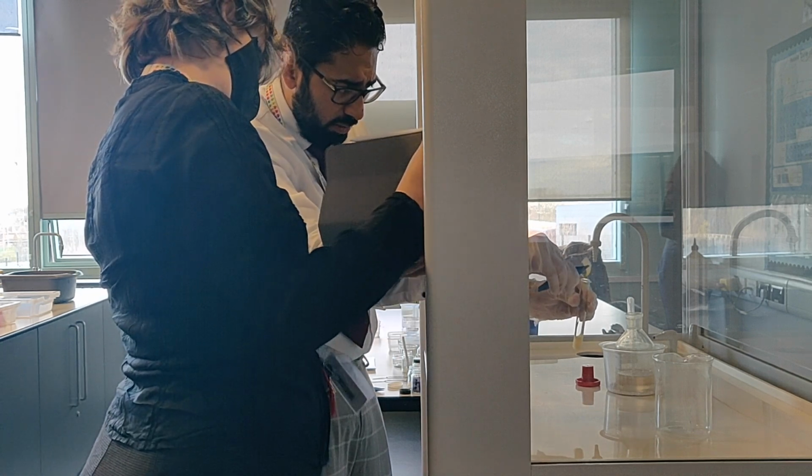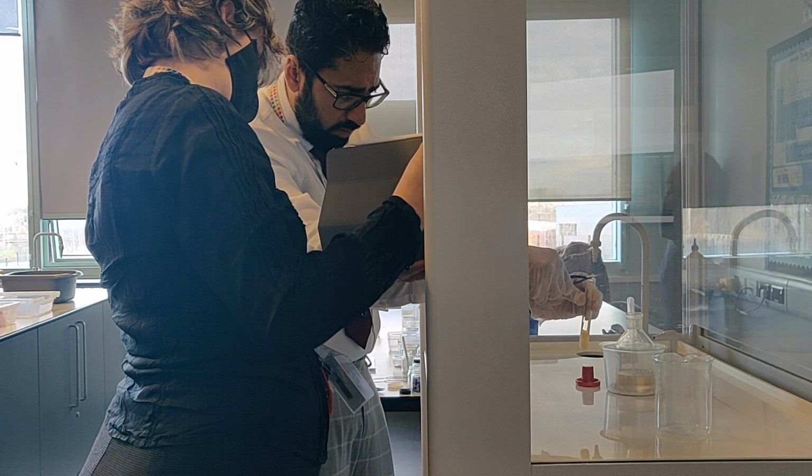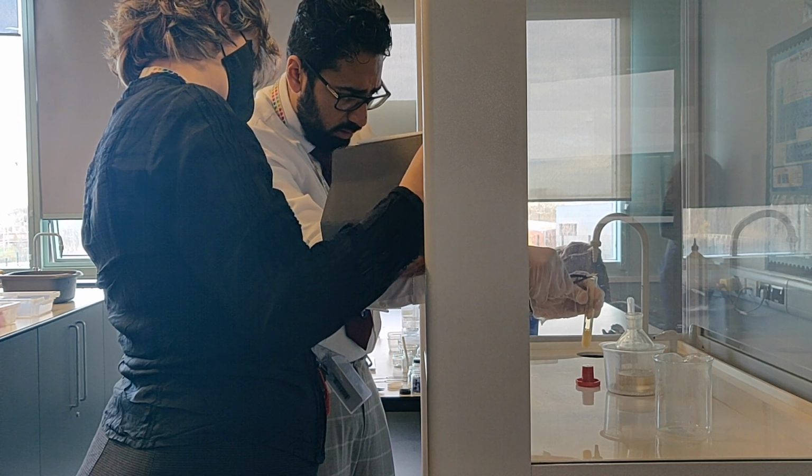See what gas has been produced, and it should really come up.